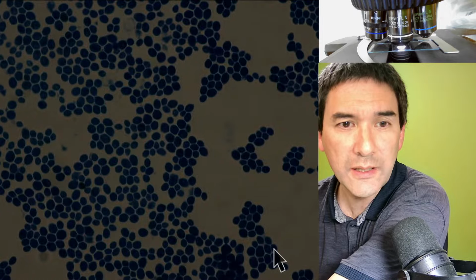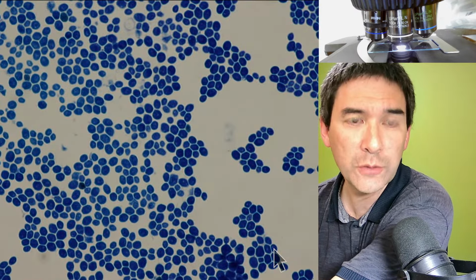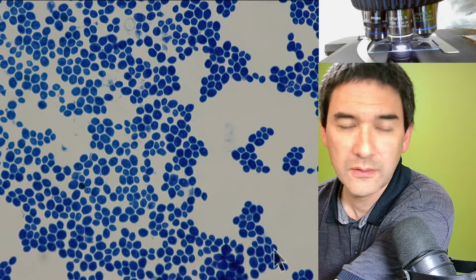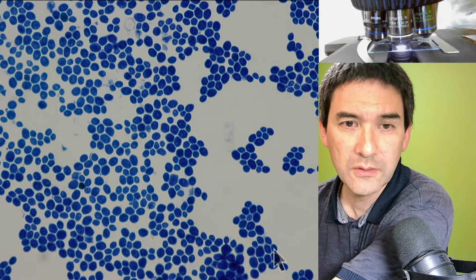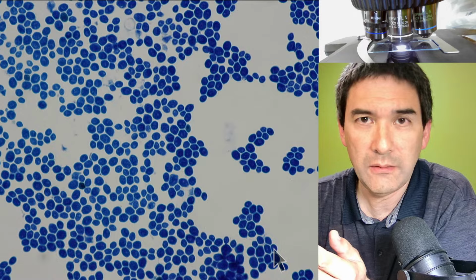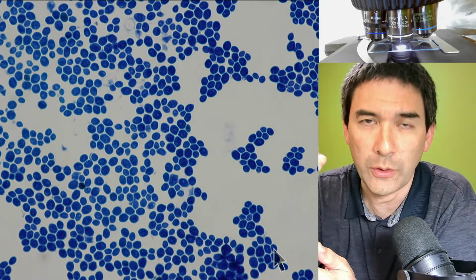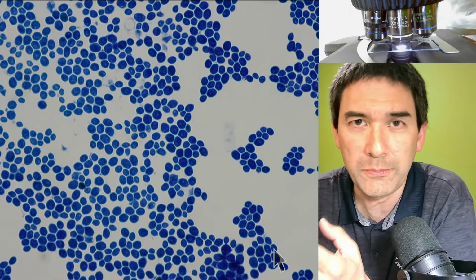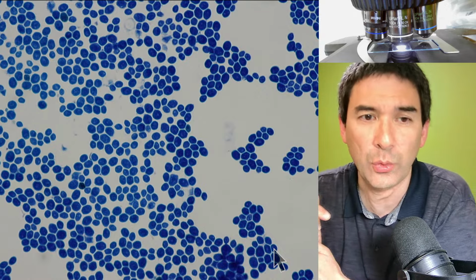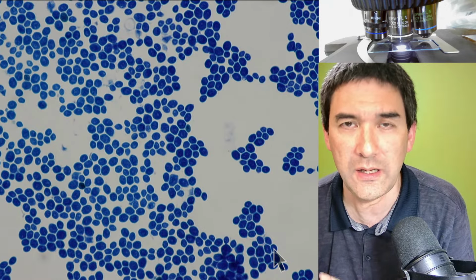And this is how it looks. Need to make it a little bit brighter. There should not be a huge difference, because essentially it's still surrounded by oil, then there is a layer of glass, the cover glass, and then there's oil on top. So the light essentially should not be influenced a lot, as it goes from oil into glass, back into oil. So the cover glass really does not serve a big purpose here.